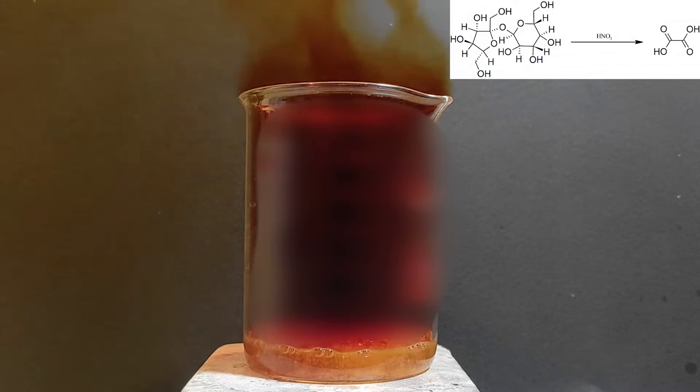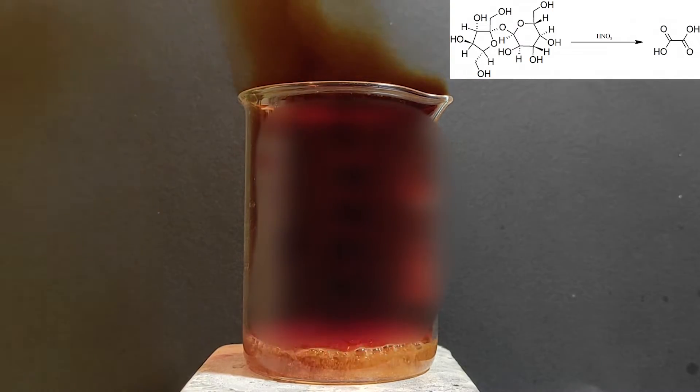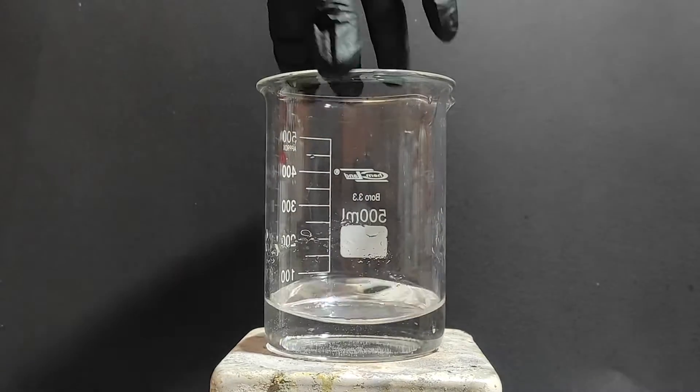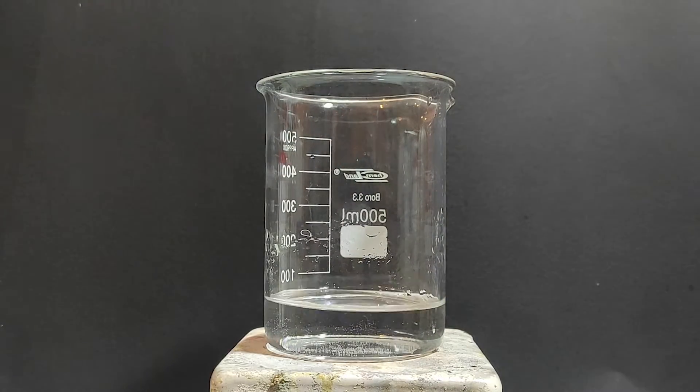If you're going to attempt this I assume that you have an idea of what you're doing and you have a basic understanding of PPE safety. Anyway I've put the oxalic acid solution outside and I've got a new beaker.